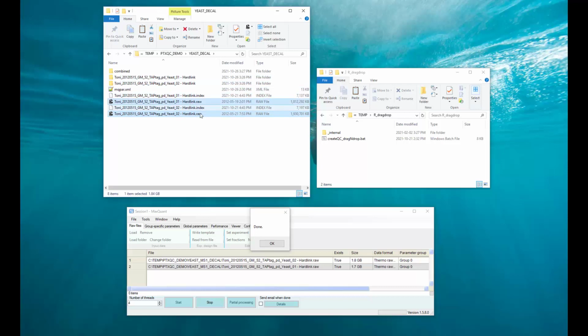Here we have the raw files, 2 of them which maxquant operated on, and all the other files that you can see are basically intermediate and final result files of maxquant. One file to mention here is the mqpar file, which contains all the parameter settings that we configured maxquant with. And this is a file that PTXQC will inspect in order to derive thresholds for certain plots. Now you can leave that file here, or even better, you can copy it to the txt folder.